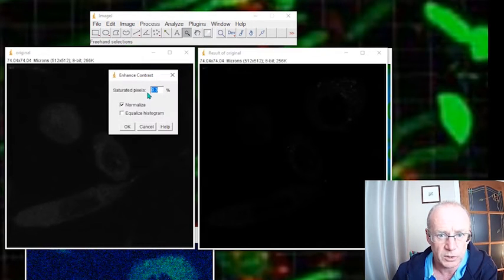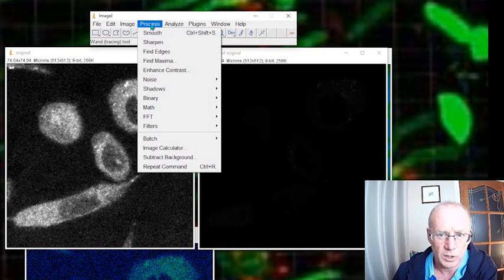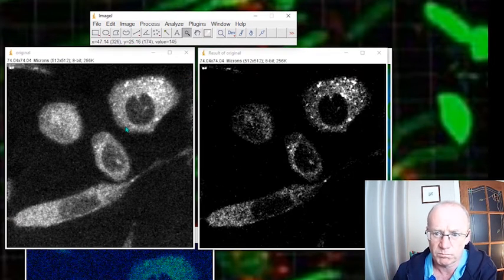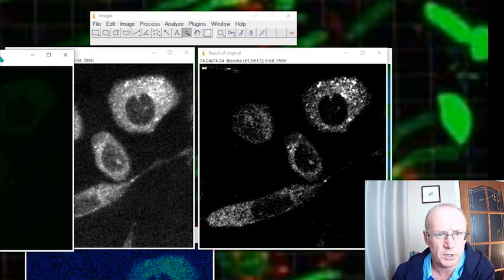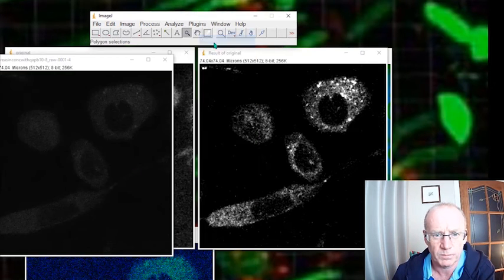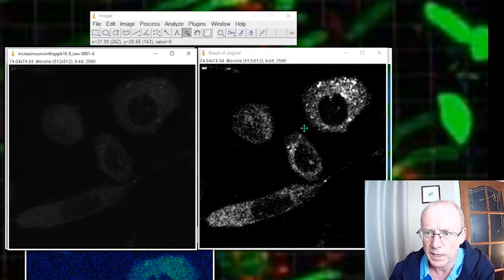I'm going to enhance the contrast on this one. I'll allow 0.3% of the pixels to reach saturation, that is the 255 value. Not too bad. Let's look at this one. Enhance contrast. Quite a nice result, I would say. So here's my original image. We'll put it back into grayscale. And I think you might agree, hopefully, that's really quite a nice cleanup of the image.